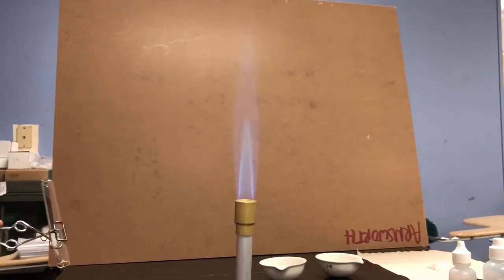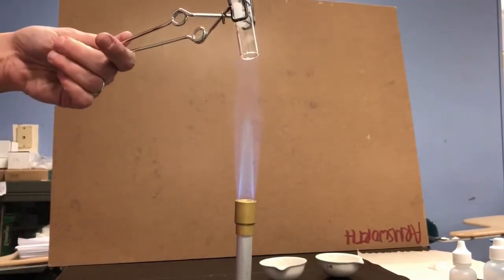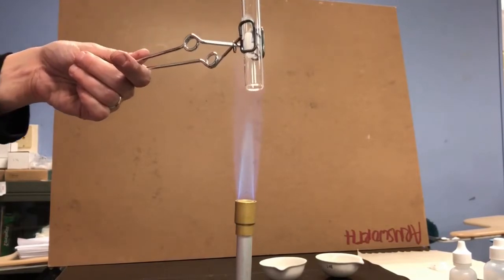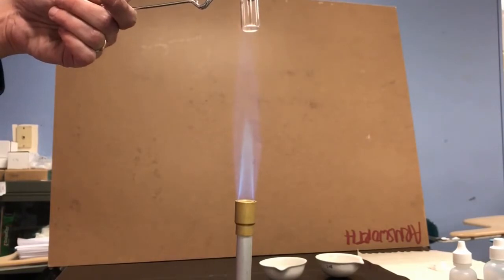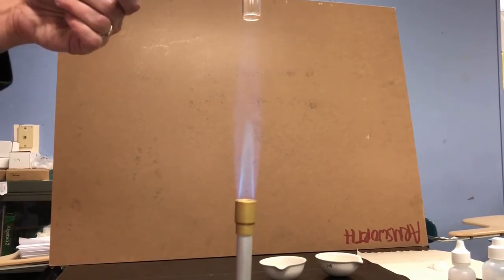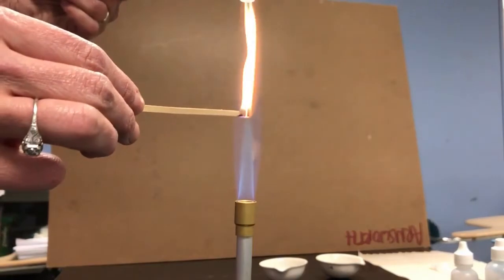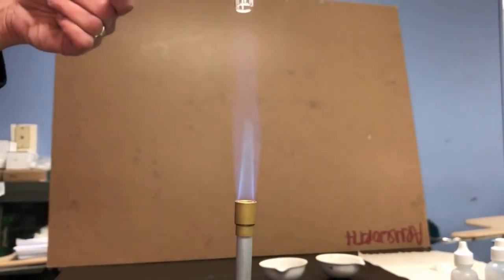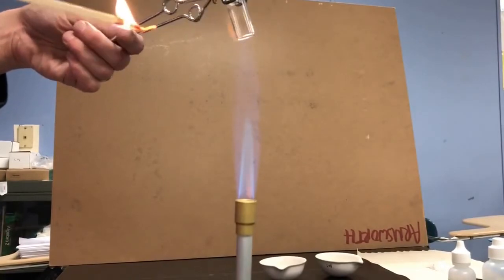We're still on reaction number 1. We've made an observation about one product that was given off. I'm going to test for another gas now. I'm going to just collect any gas that's given off by this chemical reaction going on right now. I'm collecting the gas in the test tube, and I'm going to light the splint so that it's on fire, and I'm going to put the lit splint into the test tube, not all the way down, just enough inside.